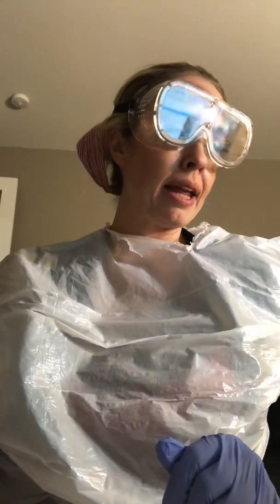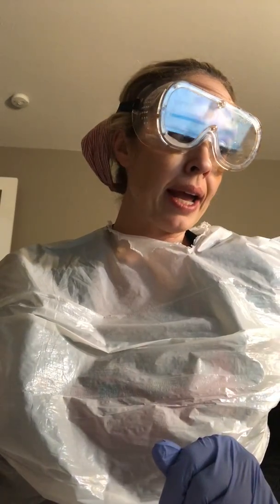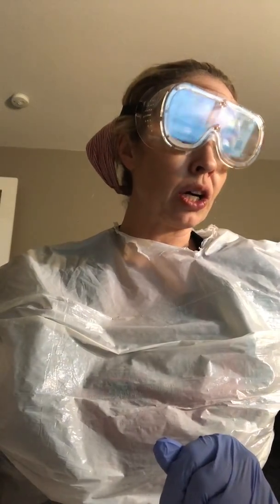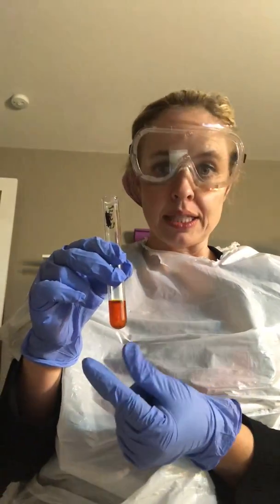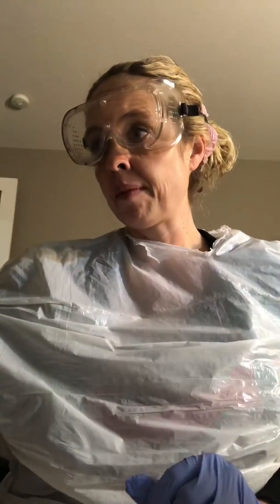The first one that I did was the methyl red test on the E. coli and the Staphylococcus epidermidis. So the first one, the E. coli, I feel like it got a lot darker, more of a reddish tint to it. So that kind of showed that it was positive for the acidic fermentation. And that was just after I added in the drops of the red to the broth.